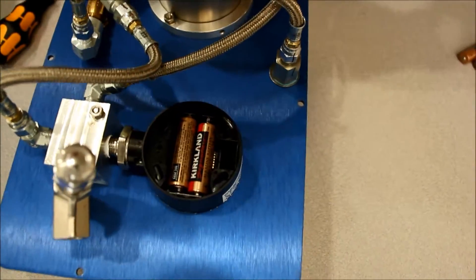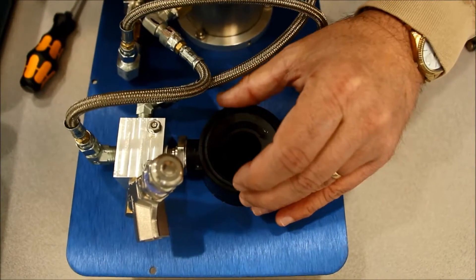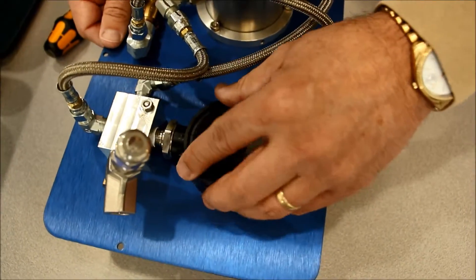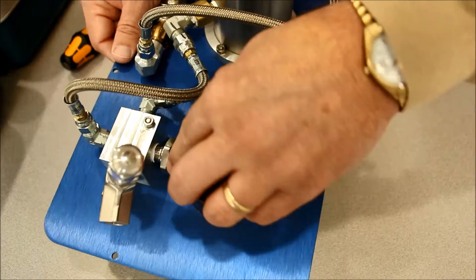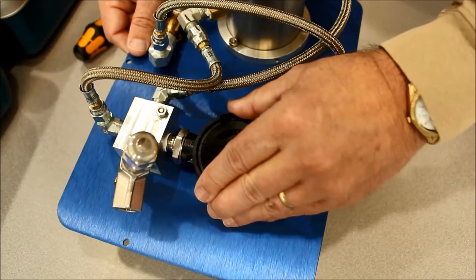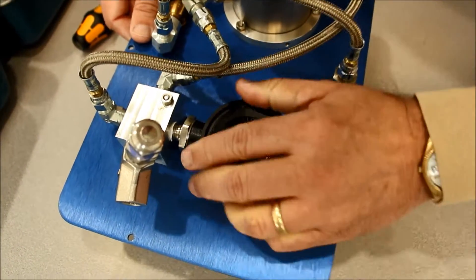Now we're just going to bring this back in and align it there. Press this down, and then twist and lock it. The new battery's in there.